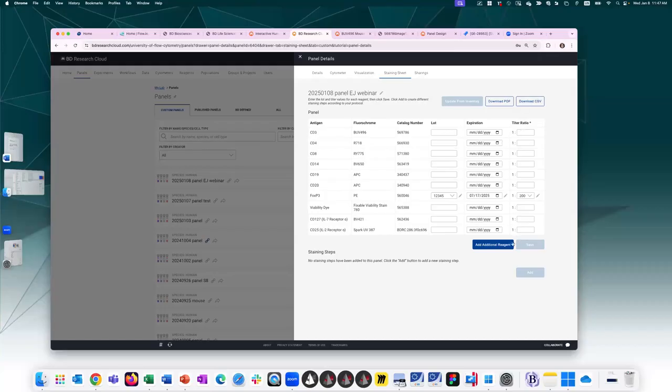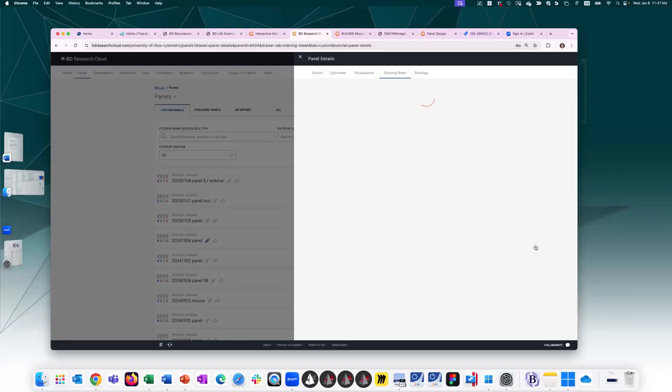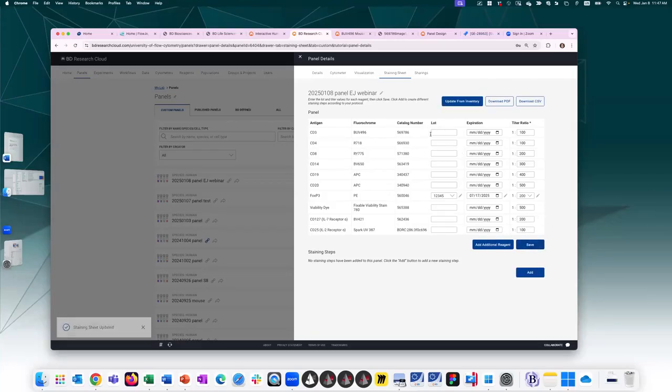If I don't have it in my inventory, not a problem. I can create a staining sheet. I'm going to just make random numbers here, 200, let's say 1 in 300, 1 in 400, just to demonstrate this ability to create a panel. Once you have titration information, you can press save. You can write the lot numbers that are written on your vials. And let's go ahead and create staining steps.